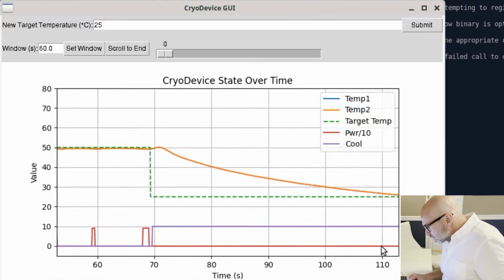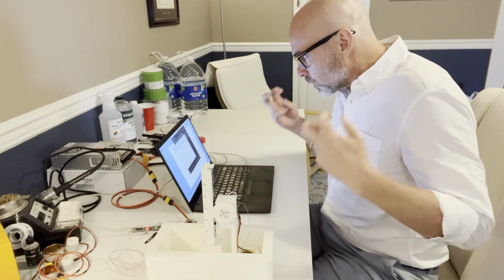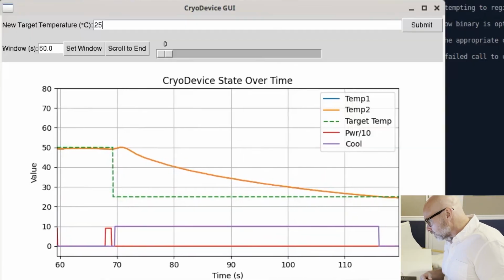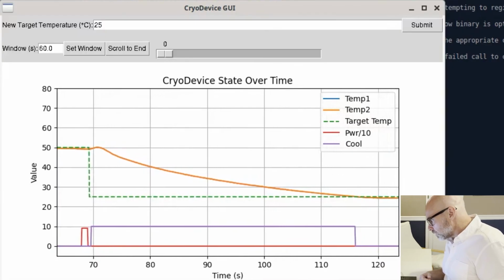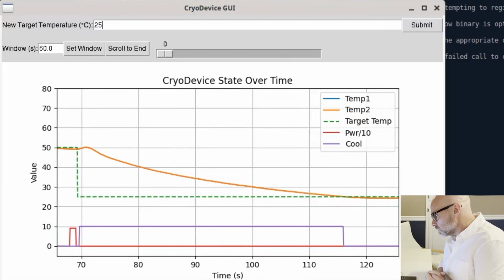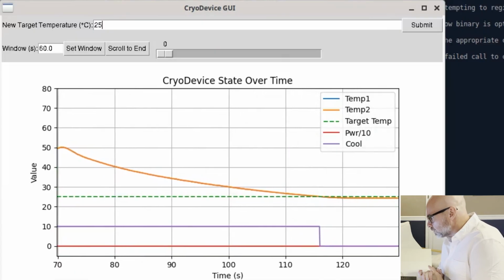But yeah, as it gets close, it should turn off the cool, which means just raise it up out of the water bath. Yeah, and then it's at 25 degrees, or excuse me, what do we command it to? Yeah, 25 degrees Celsius. All right, so that's it.